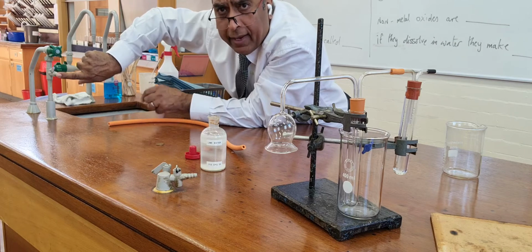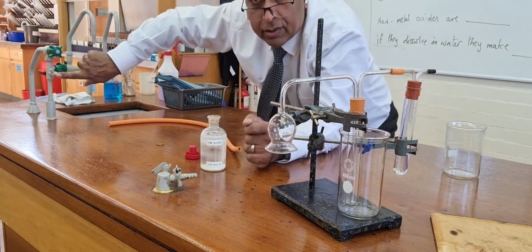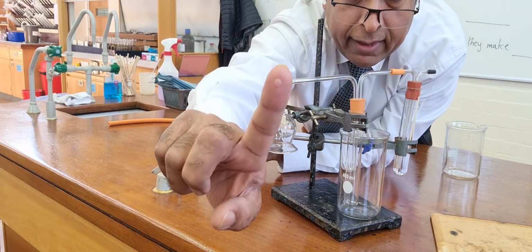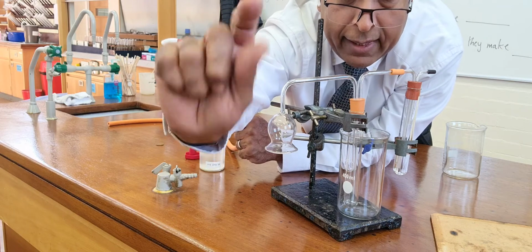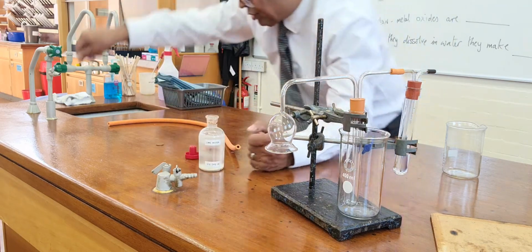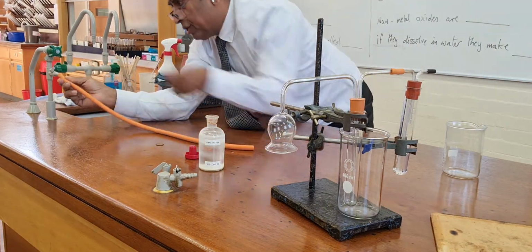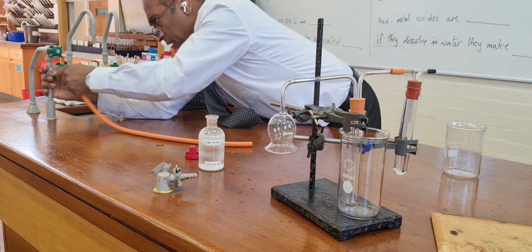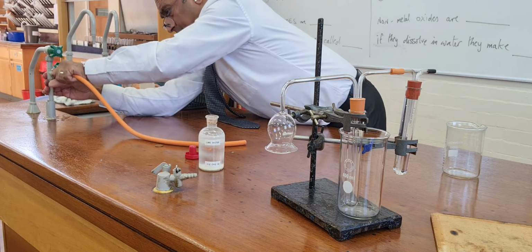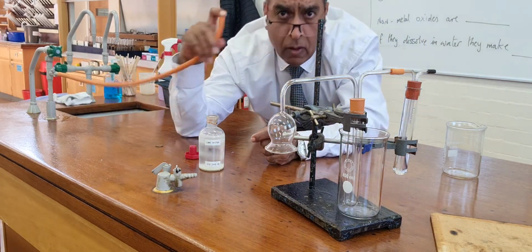Now, you see my finger is over the suction, and if I pull it out, I'm hoping you can see that my finger has been sucked there. There's a little round mark on my finger to show the suction of this. And what I'm going to do is to put this onto the suction like that, so that the suction is transferred to this tube here. See, look.